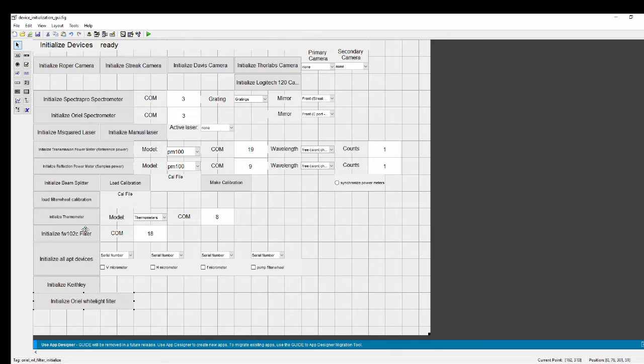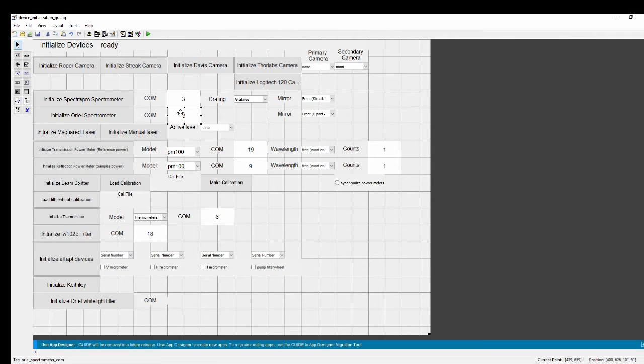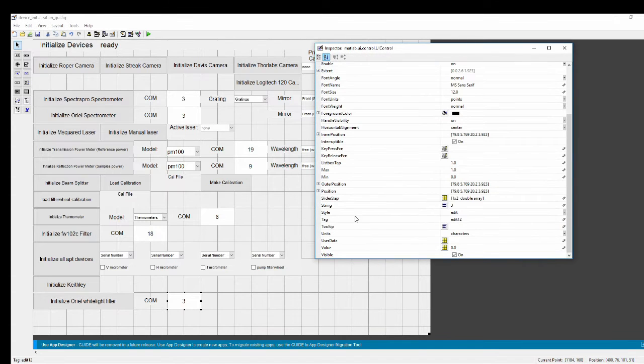Next up, we'll make a copy of this COM tag here. That way people know that the input to the right is a COM port. Doesn't really matter, but we'll go ahead and change the tag of this to Oriel white light filter COM text. Next up, we'll make a copy of this box. And these tags are very important because this is how I'm going to reference these buttons and assign callback functions to them. This one I've got that I should call it Oriel white light filter COM input.